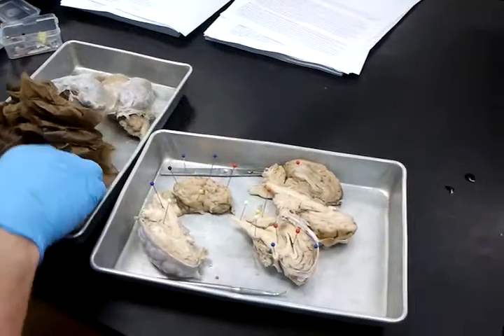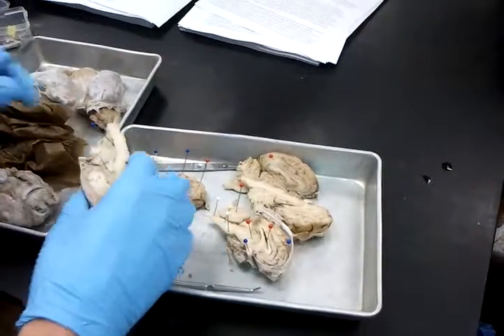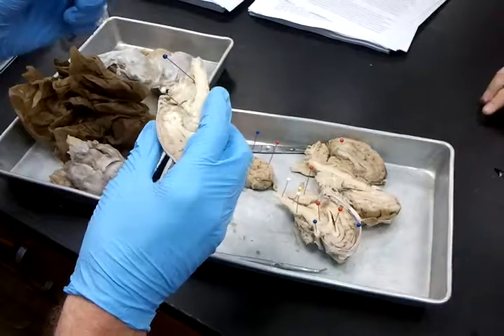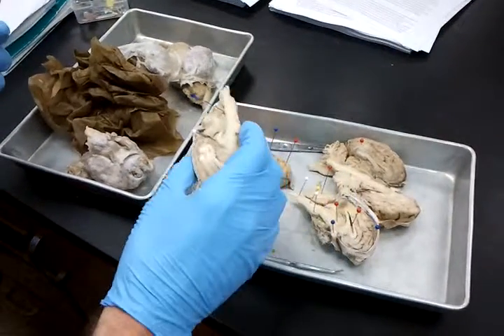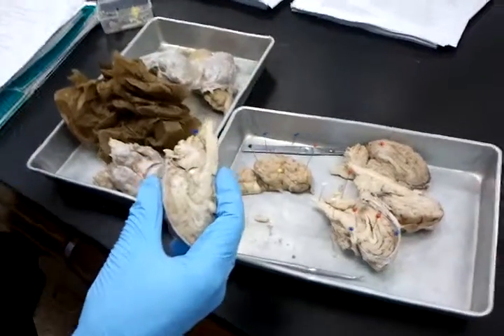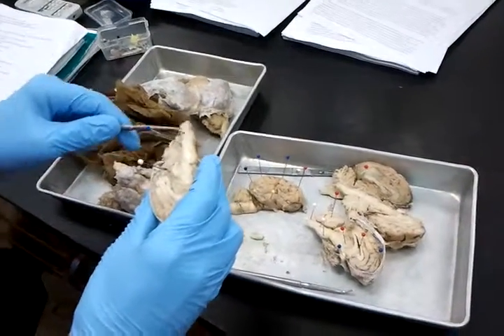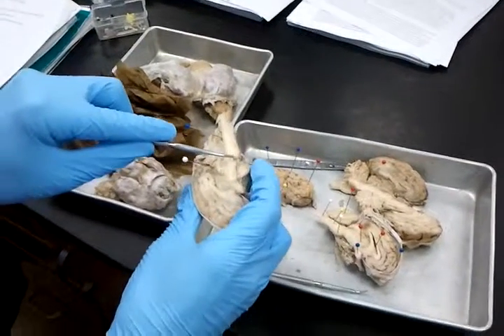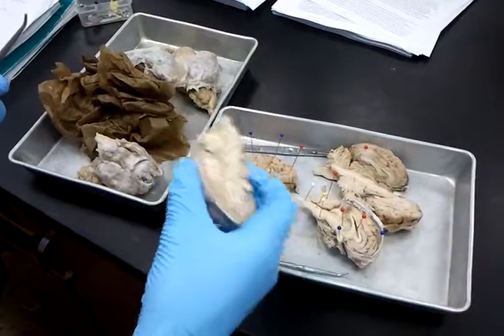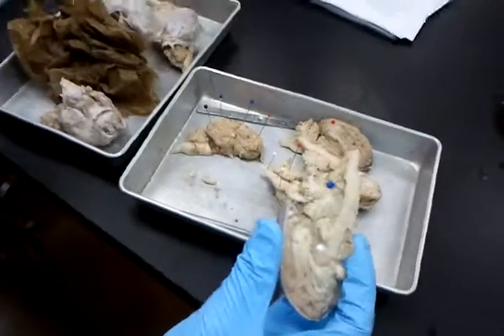And again, the fourth ventricle. If I have it pinned, I'm asking that. I lost it. Well, that's a good way to identify it. So, fourth ventricle. It's hard to really point out, but it pretty much exists between the cerebellum and the medulla oblongata. So, if I don't have this pinned, I don't have that pinned, and I'm asking about a ventricle. So it's the front. If it's the front, it's medulla oblongata. If it's the back, it's the cerebellum, but whatever. Brainstem, I'll be asking about the brainstem in the back. Medulla oblongata in this area. Pons right there. See that little kind of fleshy thing that protrudes right there. Cool. Good. So again, I don't have everything covered, but about 75% of it.